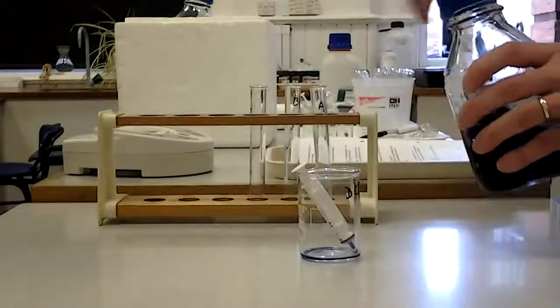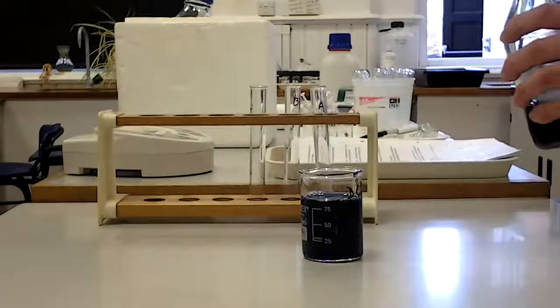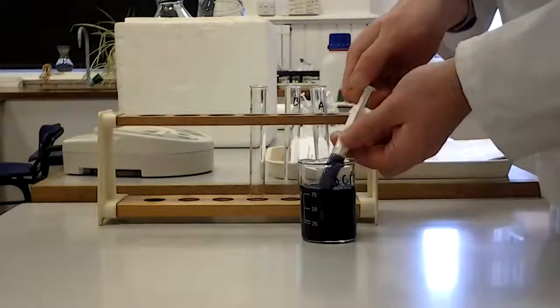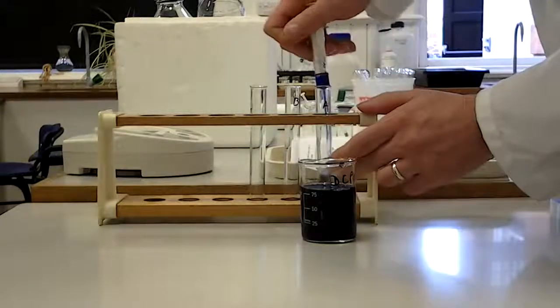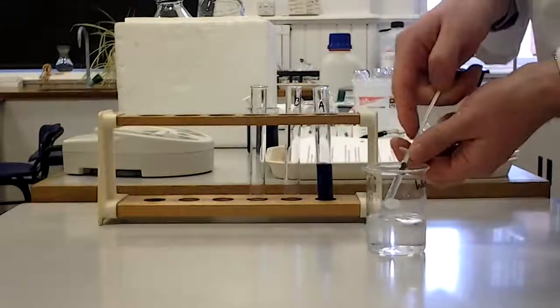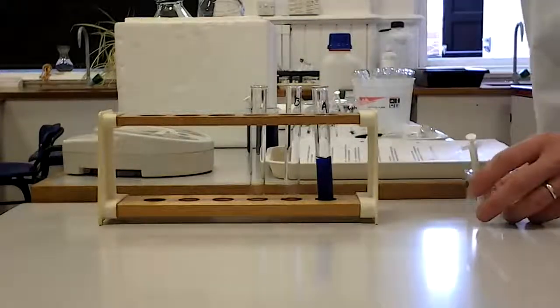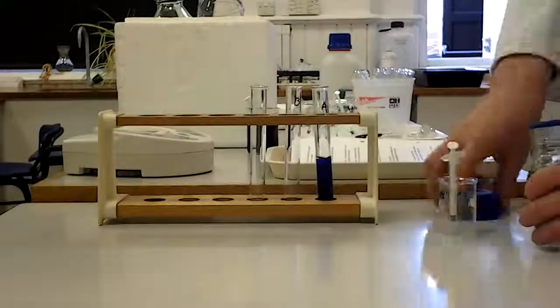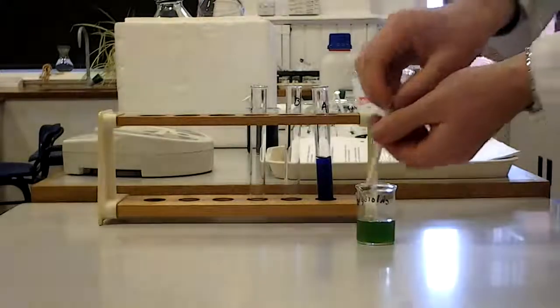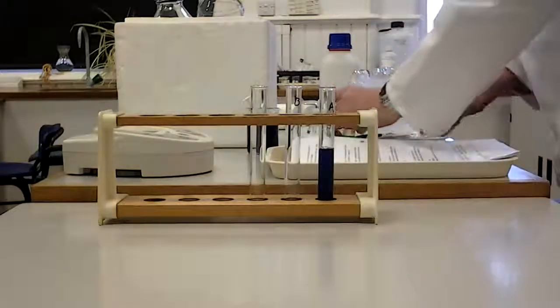I'm going to use a syringe to measure out 5 cm³ of DC-PIP, and that is going into tube A. I'm also going to put in 1 cm³ of water, and then 1 cm³ of chloroplast suspension, fresh from the ice bath. So now I've got some chloroplasts, some DC-PIP, and some water in there — a known volume of all three.